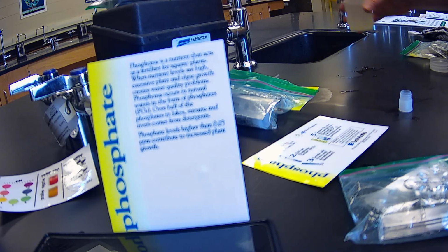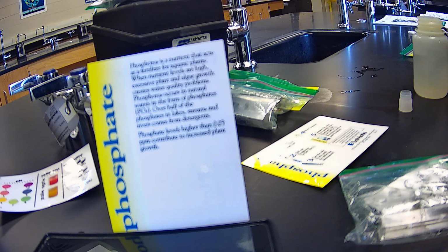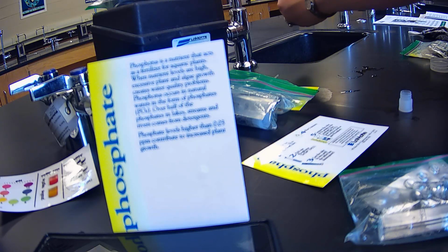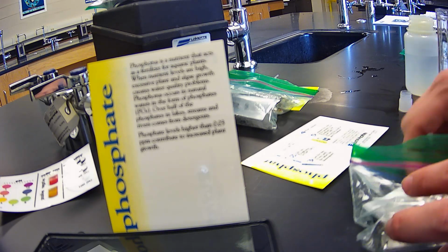So this test tube has already been cleaned. Like I said, I'd already cleaned this earlier in my test run for this video. Okay. Then we're just going to pop one tab for this one.